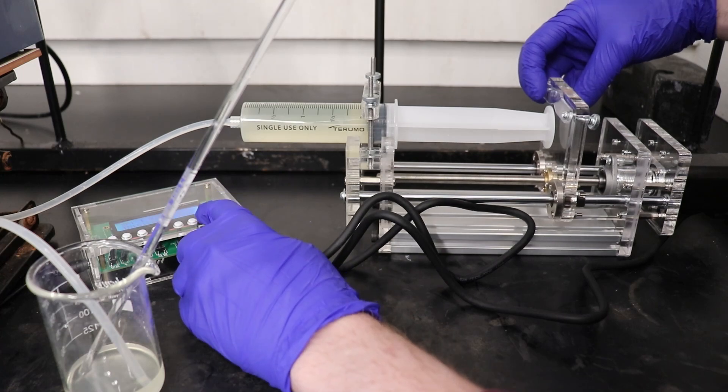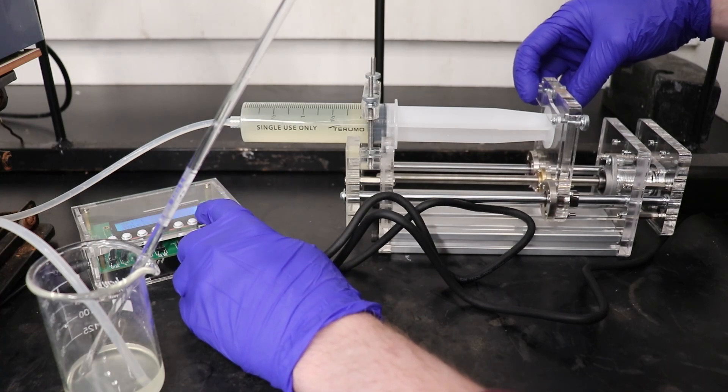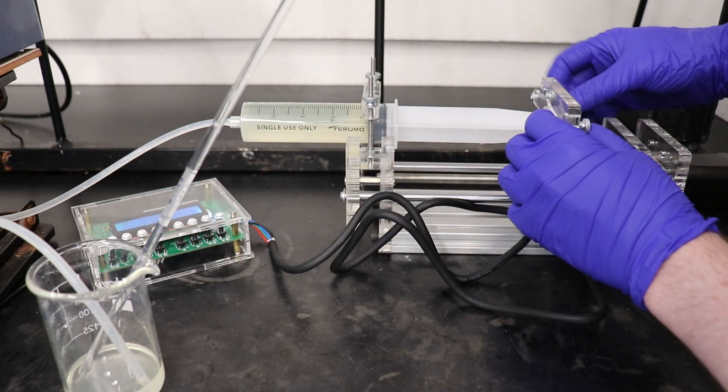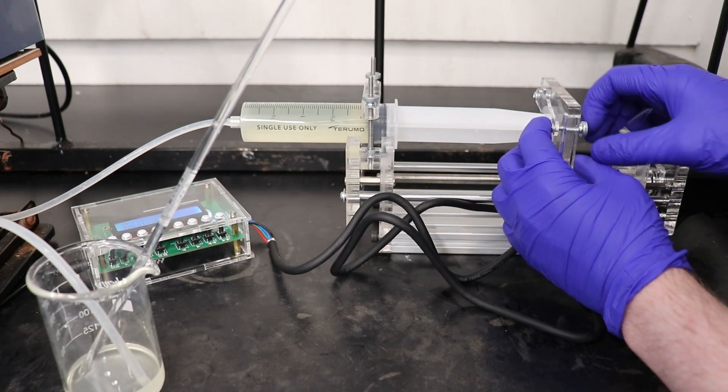This is an excess to what is actually needed for the reaction, but since I'm using a syringe pump for the addition, I'll need the excess to fill up the dead space in the tubing and syringe.